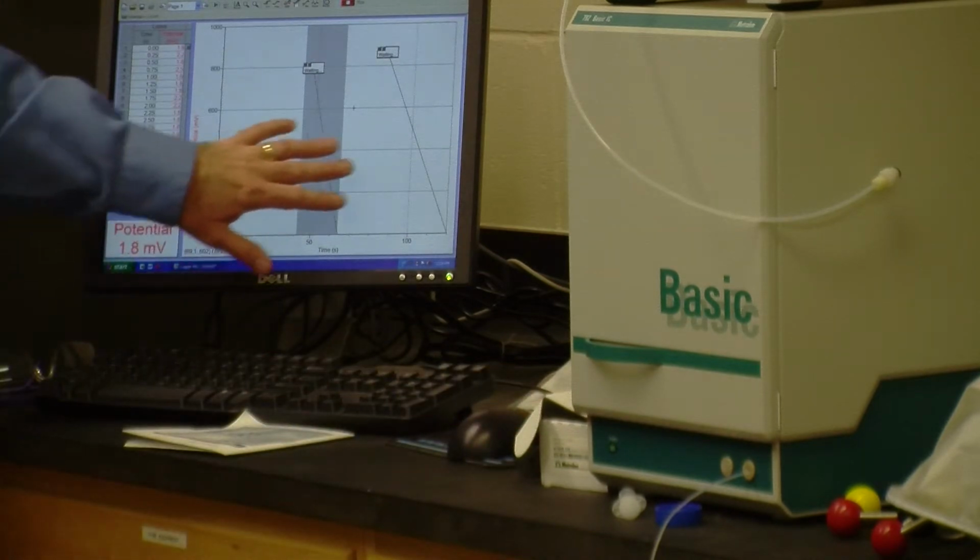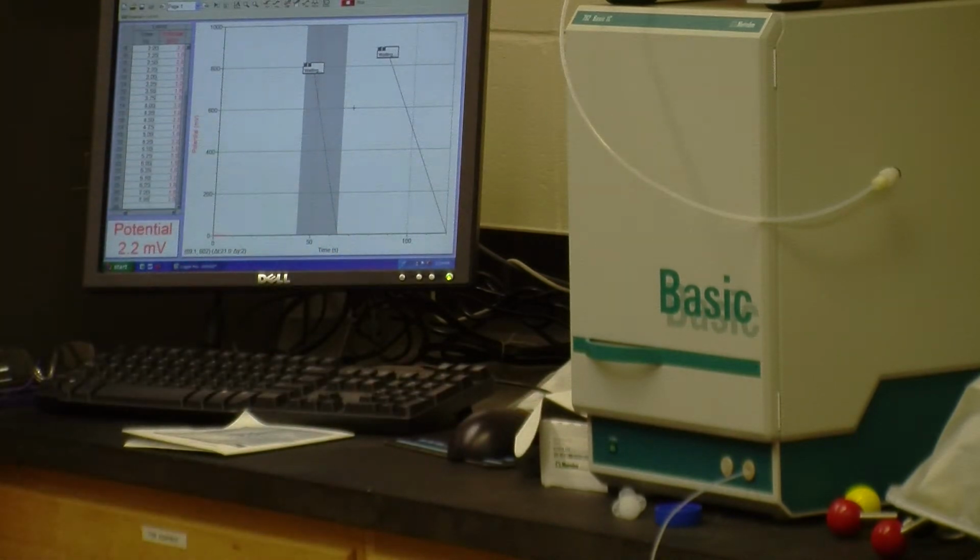Now we should see peaks show up at about the same time, and that's because the same molecule with the same gas chromatography setup should take the same amount of time to get to the end of the column. If we change something, either how fast the helium is pushing or the kind of material in the column, all bets are off. The molecule is going to behave differently.